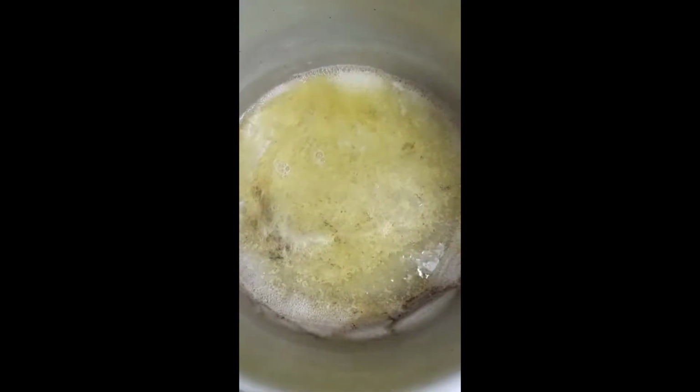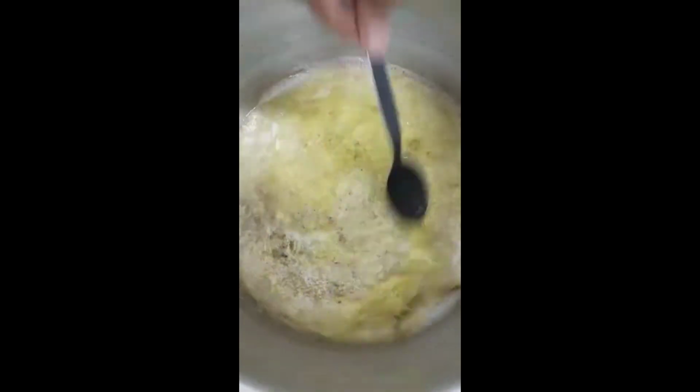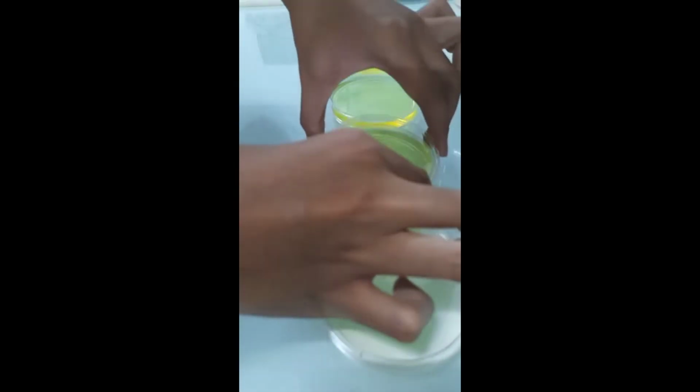Next, we add the tartaric acid solution that we have prepared in the previous step. Make sure to keep mixing the solution to avoid it solidifying too fast. Lastly, while it's still piping hot, carefully transfer the hot media into the sterile petri dishes. For these steps, make sure to ready the petri dishes beforehand so that we can quickly transfer the media and quickly close the containers to avoid contamination.